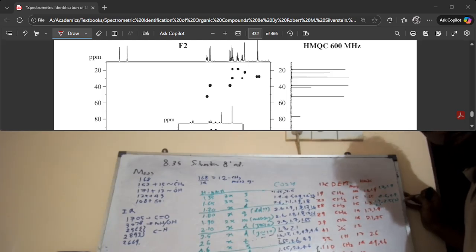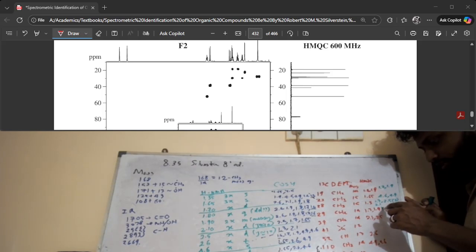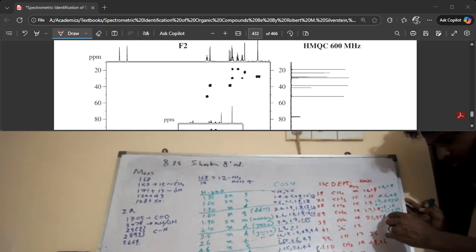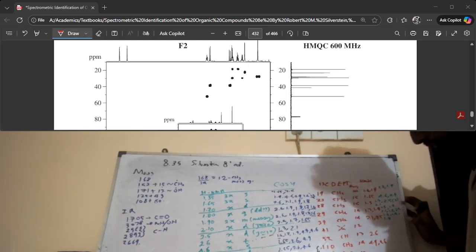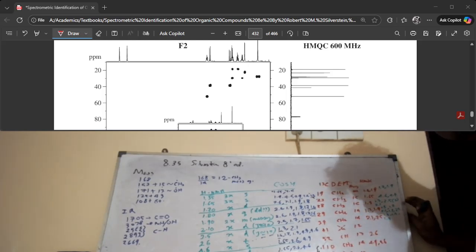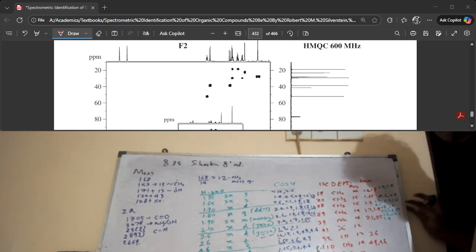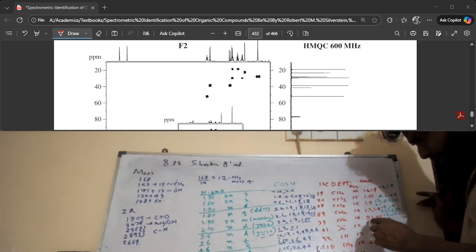For the carbon at 29, you have HMBC correlations at 1.3, 1.8, 2.1, 1.9, and 2.5. So 39 has correlations at 1.3, 1.7, and 1.9. 41 has correlations. There are so many correlations for 41, right? Which is not shocking because it's a quaternary carbon, so it must have many correlations in HMBC, right?